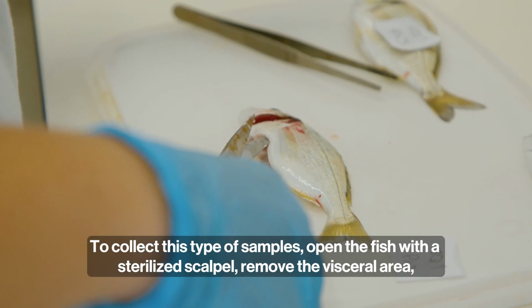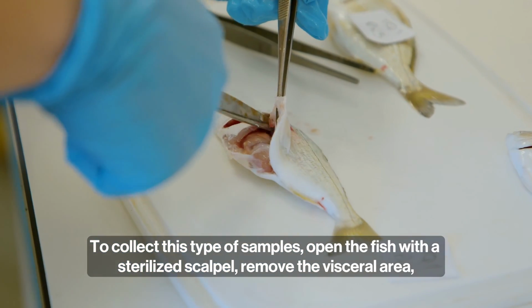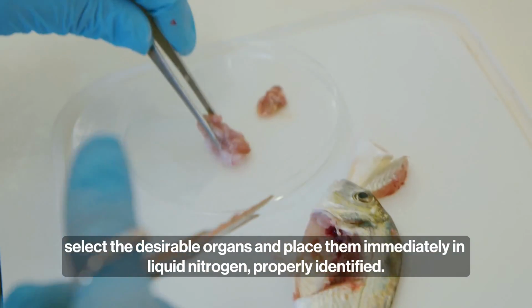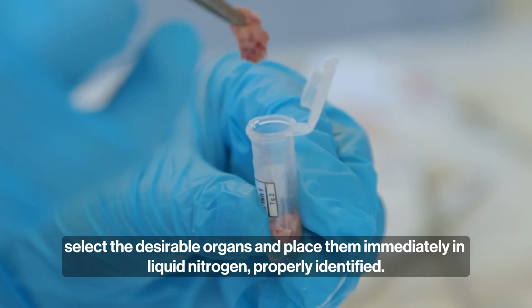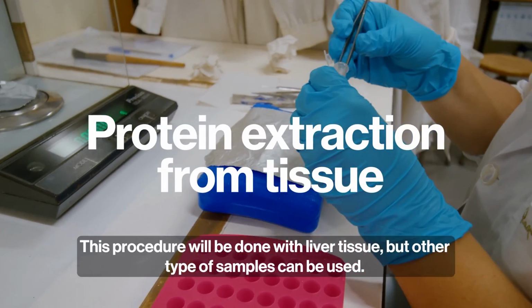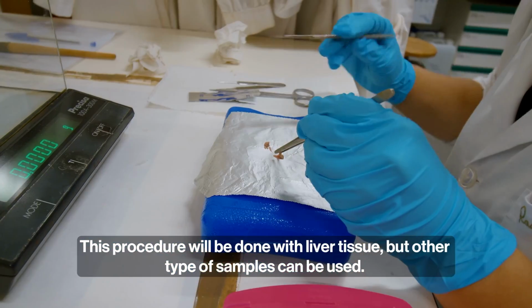To collect this type of sample, open the fish with a sterilized scalpel, remove the visceral area, select the desirable organs and place them immediately in liquid nitrogen, properly identified. This procedure will be done with liver tissue, but other types of samples can be used.